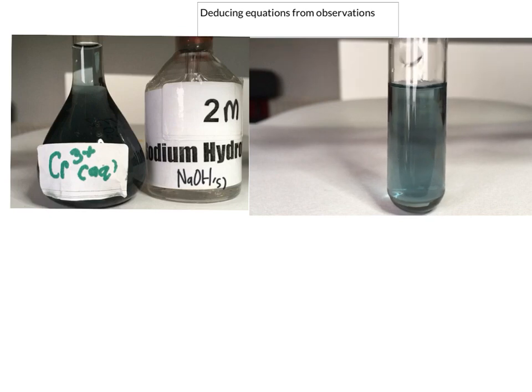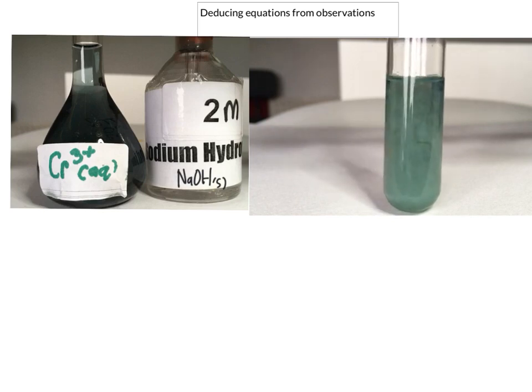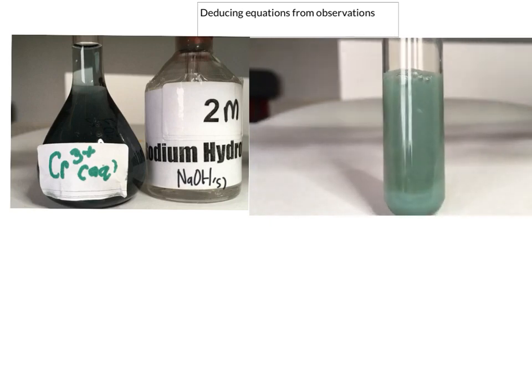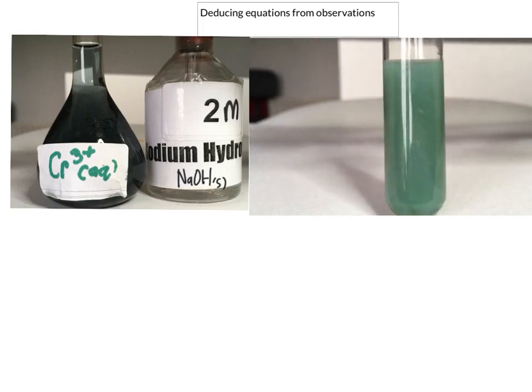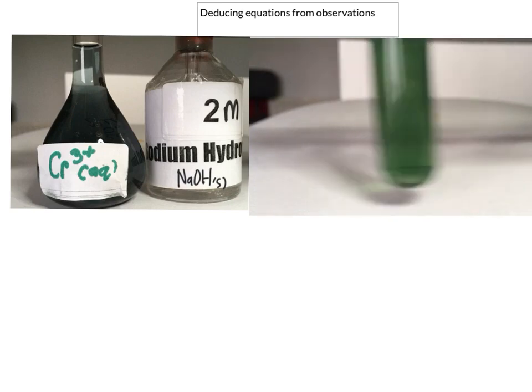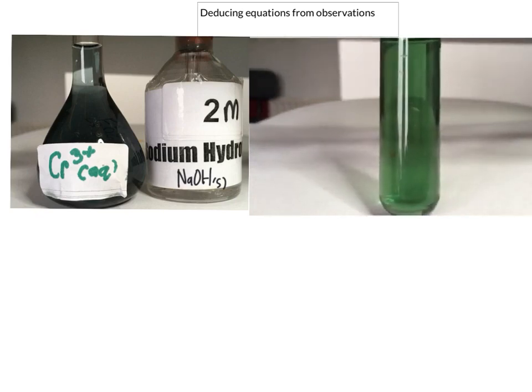When chromium is reacted with sodium hydroxide, watch carefully what happens when the test tube is shaken and an excess of sodium hydroxide is added. So there's the initial sodium hydroxide, and I'm now going to add the sodium hydroxide in excess. And this didn't happen with any of the 2+ or the 3+ ions. So let's have a look what happens when we add the sodium hydroxide in excess. Can you write an observation for that reaction? And can you write equations for the reaction that took place?